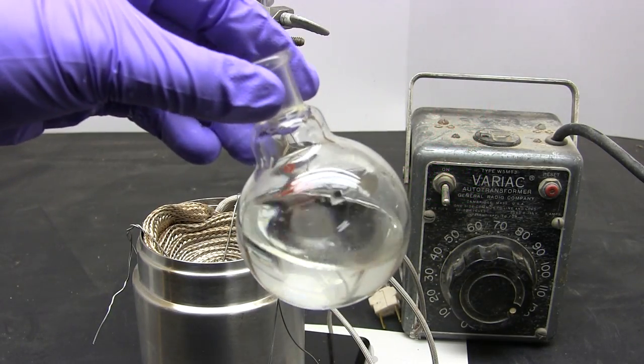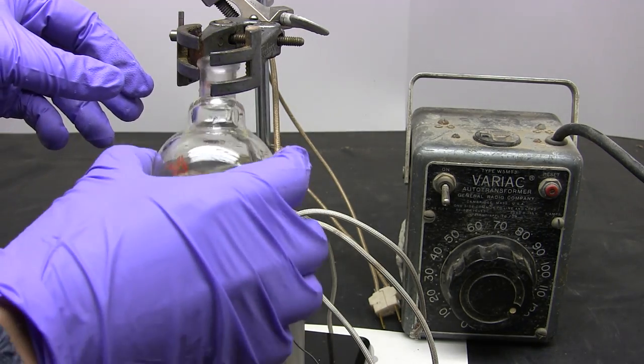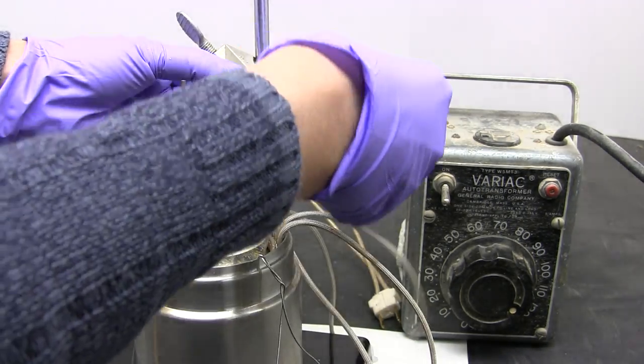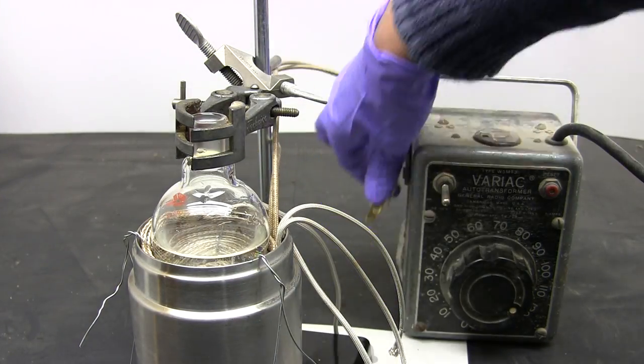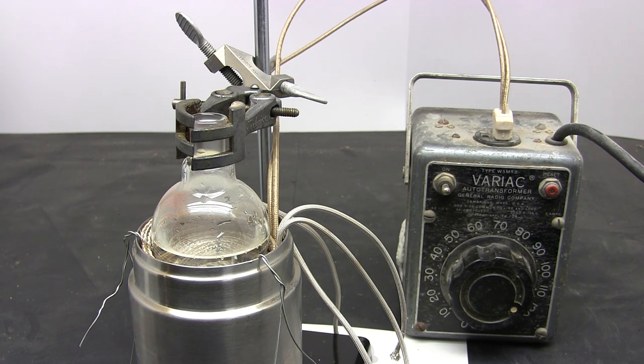For our test I'm just going to go with something simple and boil water. Always set up your apparatus first and plug it in last for safety. Power it up and don't touch it while it's operating. Always power it down and unplug if you need to handle it. Let's give it about five minutes.